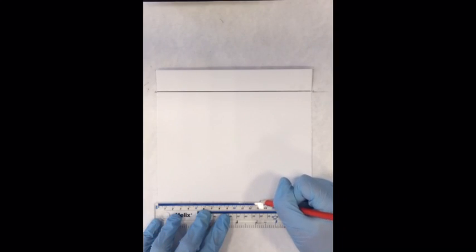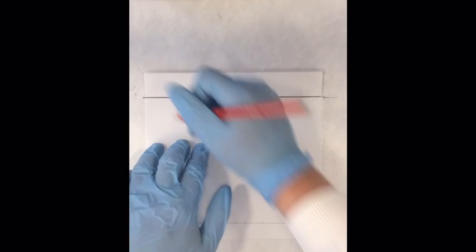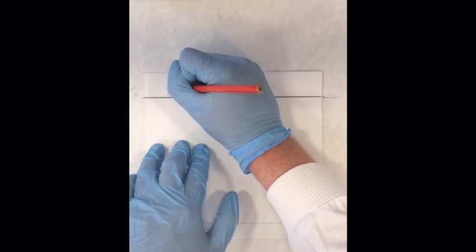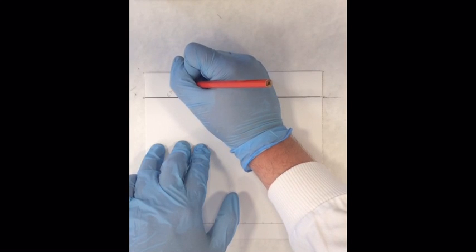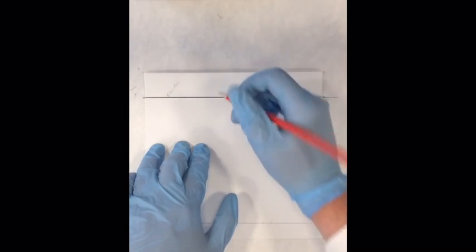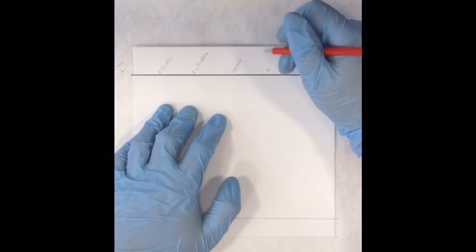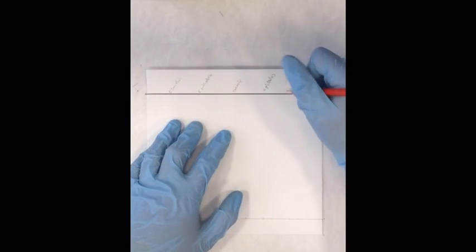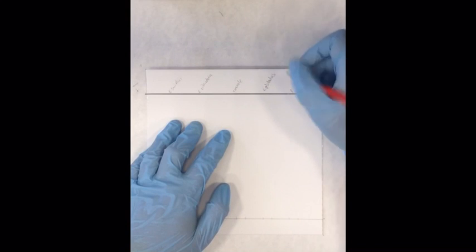Carefully mark out the different bands on the baseline, making sure there's enough distance between them and that the spots don't overlap. Make sure to always write on the top of your plate. The information on the top of the plate should always correspond to the spots below. Don't forget to put your name and also your bench number on the top of the plate.